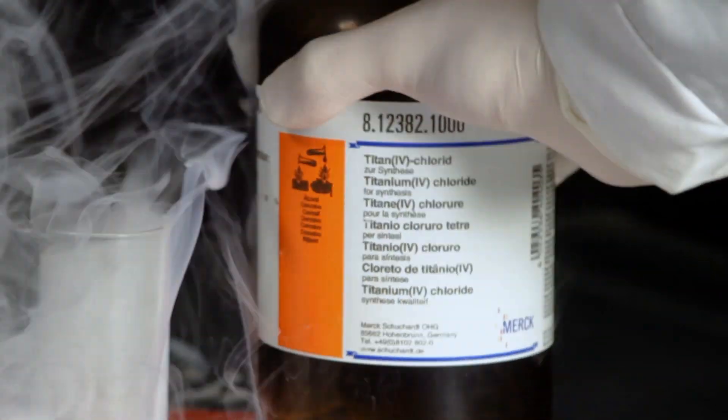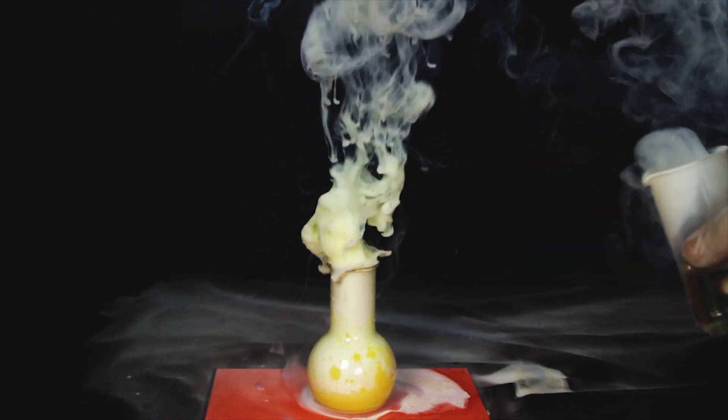That, in fact, leads to the formation of this very smoking liquid, titanium tetrachloride.